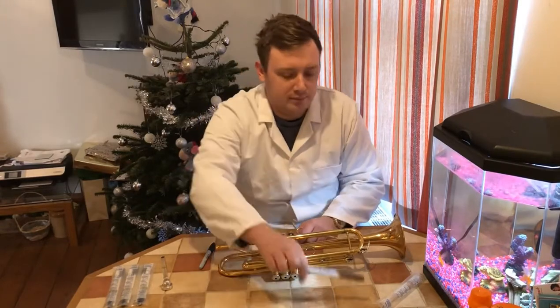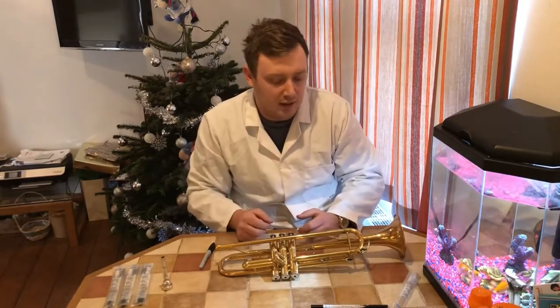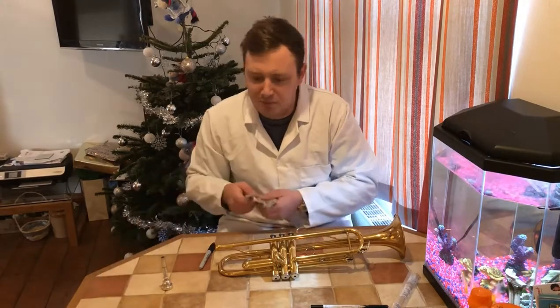That way, when we've plated it out, we know what we've got. I'm going to carry on and swab in a few different places. I'll try to get some close-ups, and hopefully we should be able to grow some interesting bacteria.